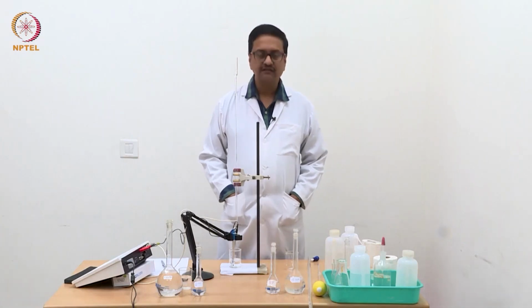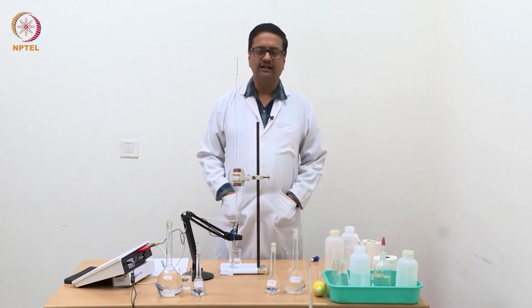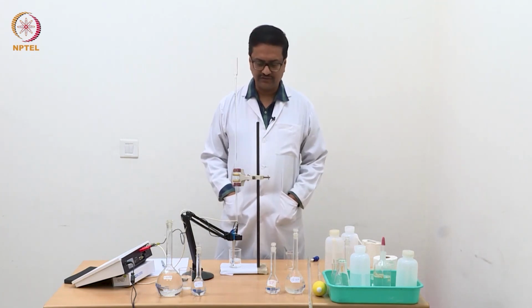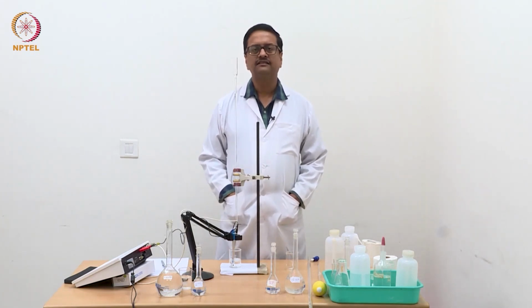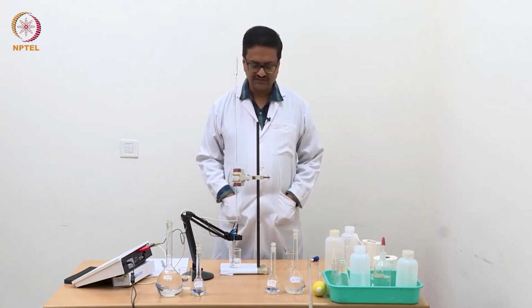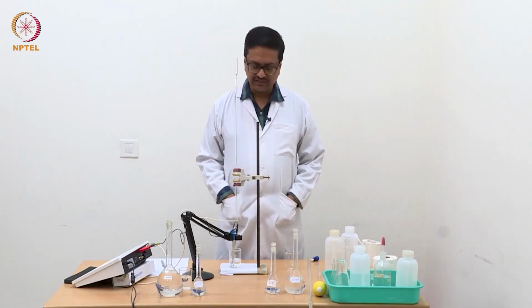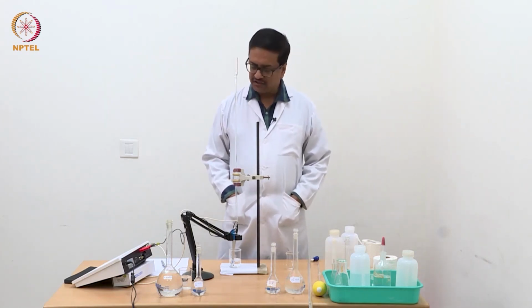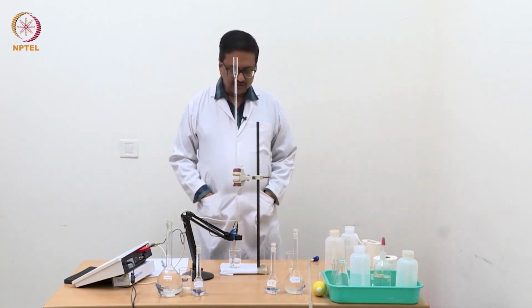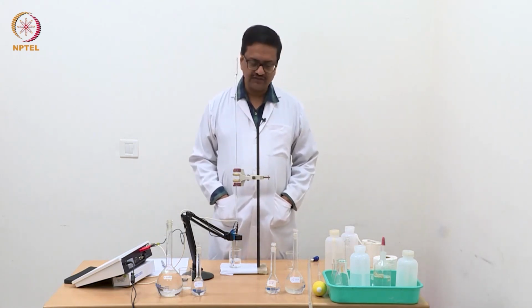Hello everyone, welcome back to this course Elementary Electrochemistry. As you can understand, today we are going to demonstrate a few experiments. We have already discussed potentiometric titrations and have done demonstrations on that. Hope you have followed those demonstrations and the follow-up lectures where we discussed the calculation and graph plotting after the experiment was conducted. So today we are going to demonstrate the experiments related to conductivity.